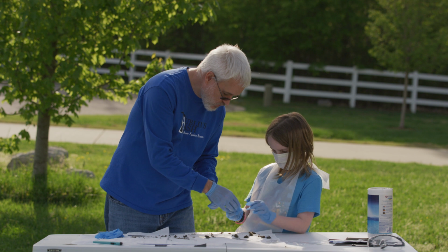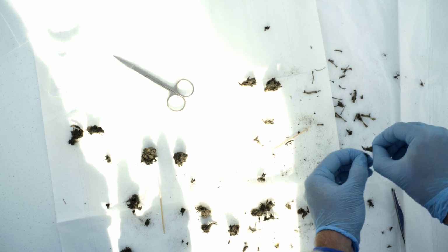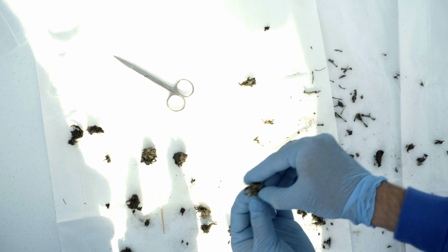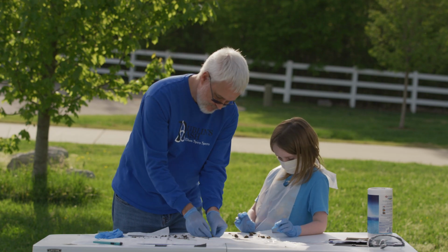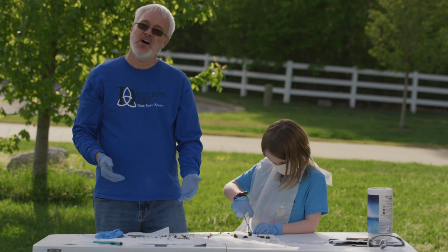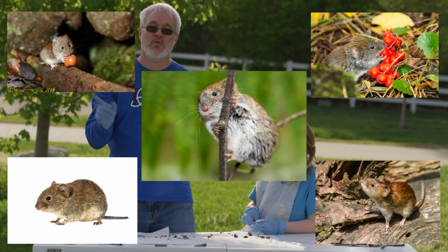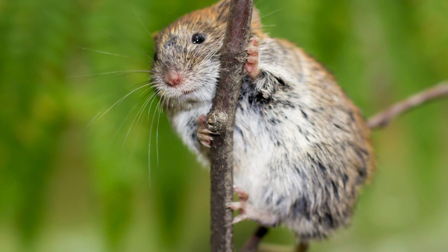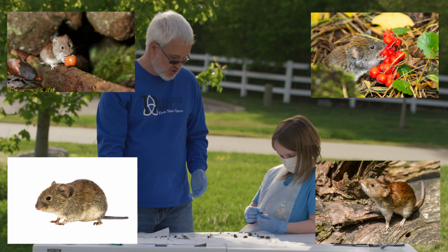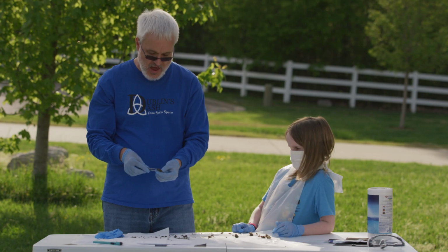Oh, that's a big bone. See that? Yep, that's a good one. Oh, that's a lower jaw for this one. So these two go together. Chomp, chomp, chomp. So what we'll do is I'll try to find some good pictures of some voles, and we'll post those either here or here or here. There'll be some pictures that we can look at and then kind of give us an idea about what these guys look like. Oh, this is a big bone. But there we go. And then all the rest of this is going to be just all the fur that the owl was not able to digest.